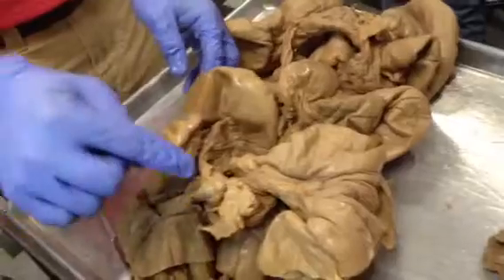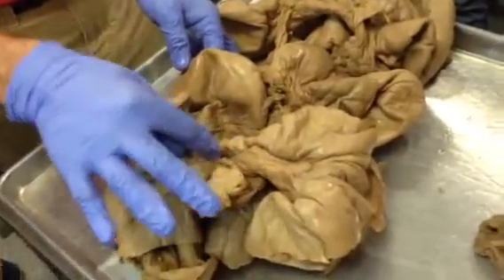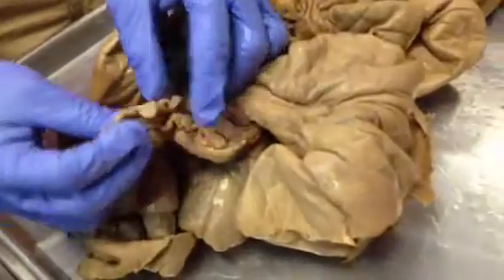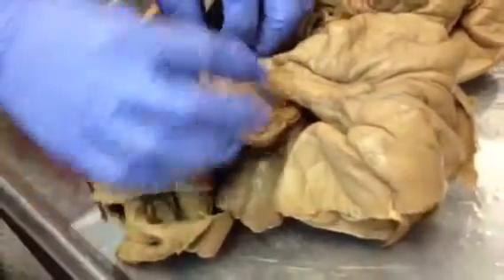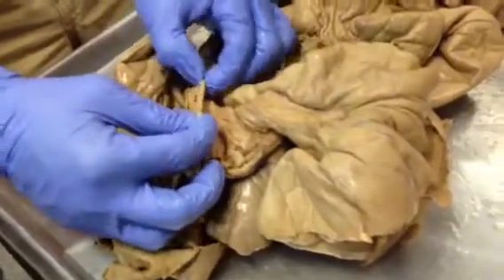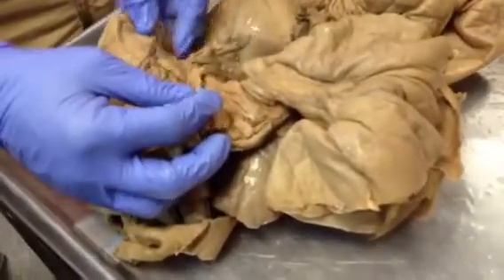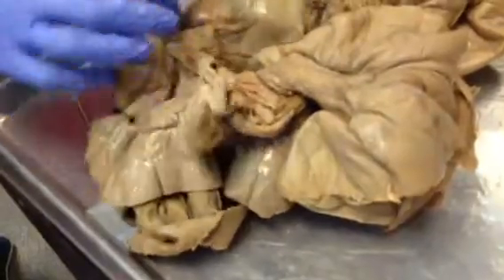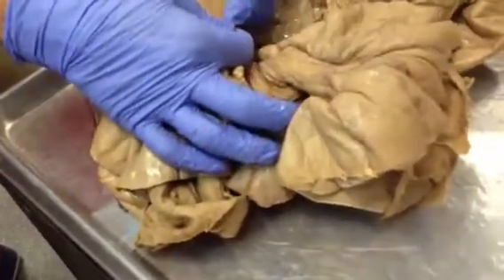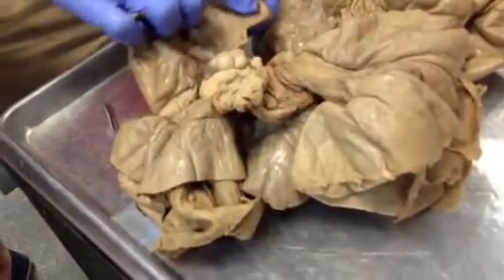So ovary, fimbriae, oviduct, or fallopian. Okay, the oviduct is the little wavy part, that wavy tube, but there is a kind of a straighter section. I've kind of isolated it a little bit. And it runs down into the fallopian tube. This is the fallopian tube. And then it ultimately becomes the uterus, like right there. It widens out into the uterus.